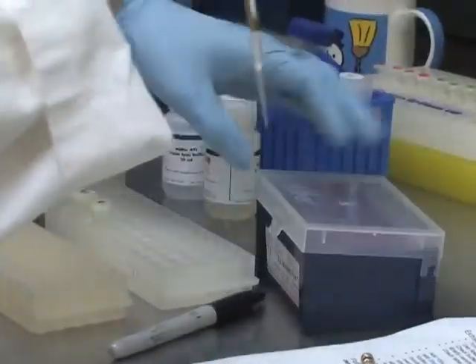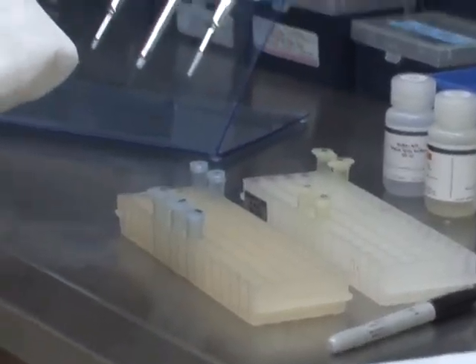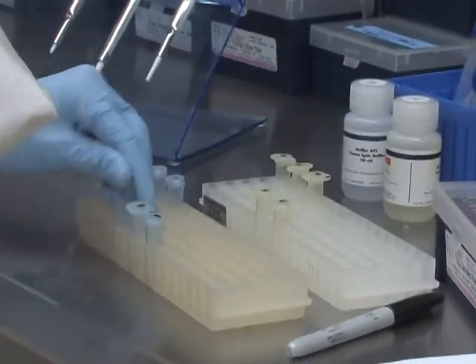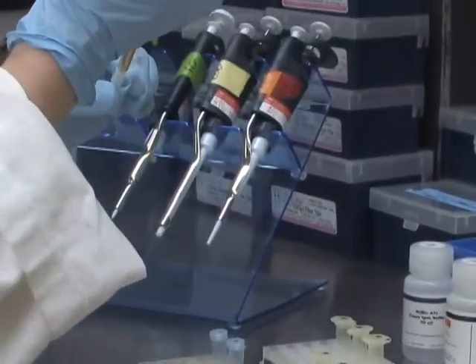So I designed different combinations of primers and probes that matched the DNA sequence of C. shasta, and I tried several recipes to see which chemistry worked the best. The probe is quite similar to the primers in that it's just a sequence of oligonucleotides, but it sticks to the DNA sequence in between the 2 primers.